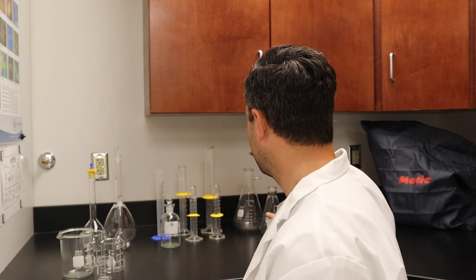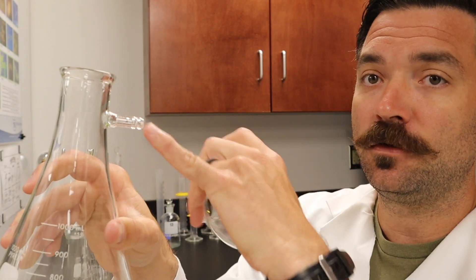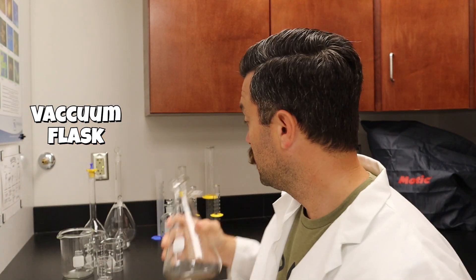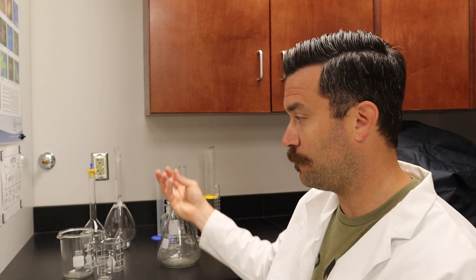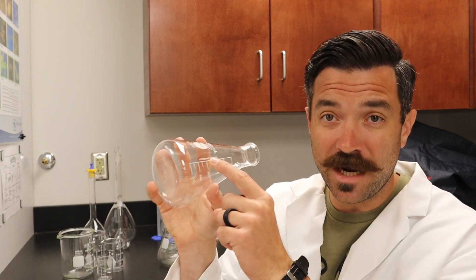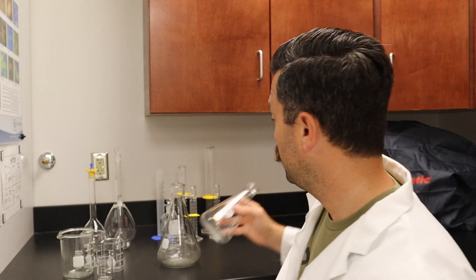Next up are the flasks. This one is an Erlenmeyer flask — a general-purpose flask. This other one has a unique side arm, making it a vacuum flask. For tests like TSS and mixed liquor, you hook a hose up to that side arm connected to a pump, which pulls liquid through your filter. All that's left on the filter are the solids — which is what you want. These have approximate volumes, so 500 mils on the side doesn't guarantee exactly 500 inside. Great for holding and pouring samples.